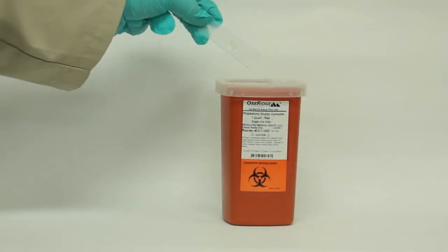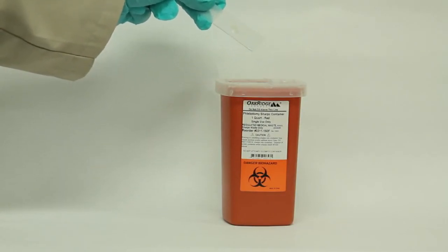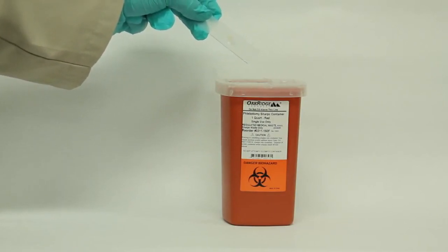Once you finish using the slides for your catalase test, remember they should be disposed of in the biohazard sharp container as they are a biohazard.